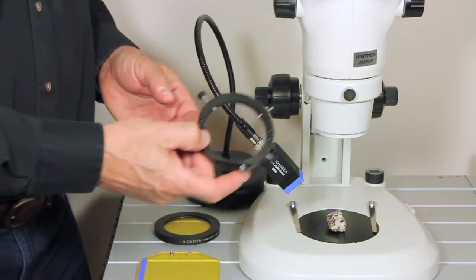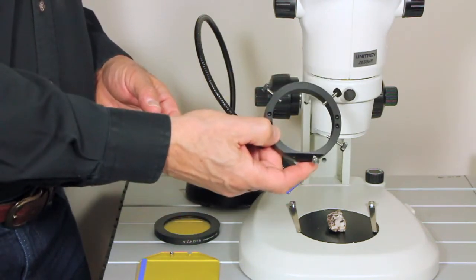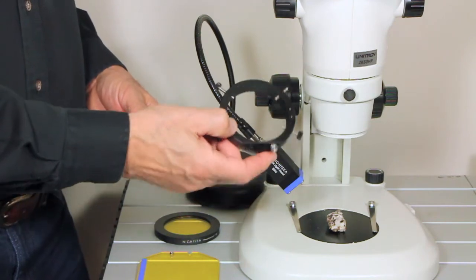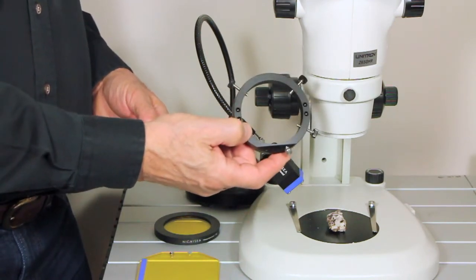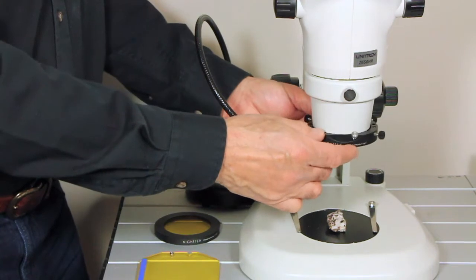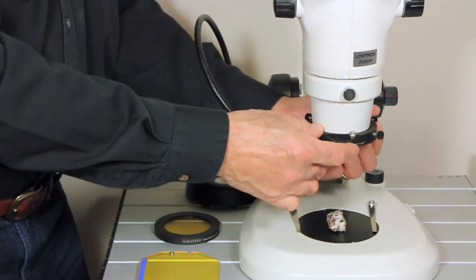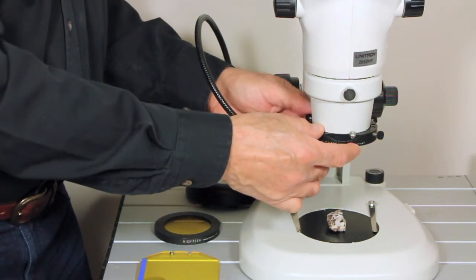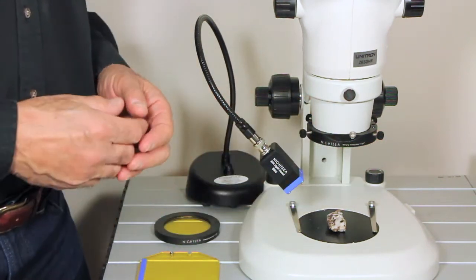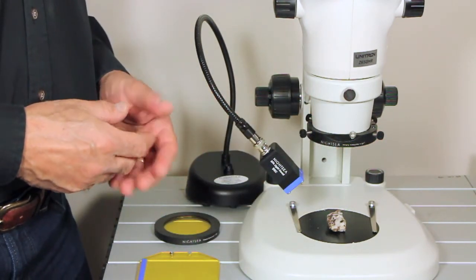The only thing we're putting on the microscope is this empty adapter ring. This goes where a ring light would attach. The diameter difference is made up with the thumb screws, makes it pretty much universal. And we do have some custom adapters for some oddball microscopes. That ring is empty, so it's not in your way when you're doing other white light work.